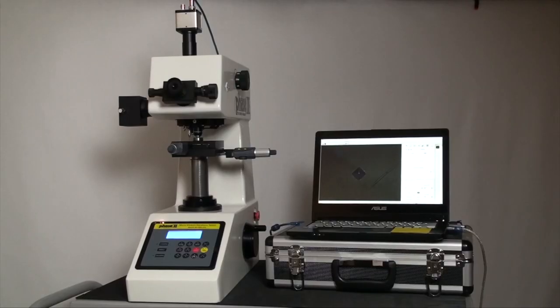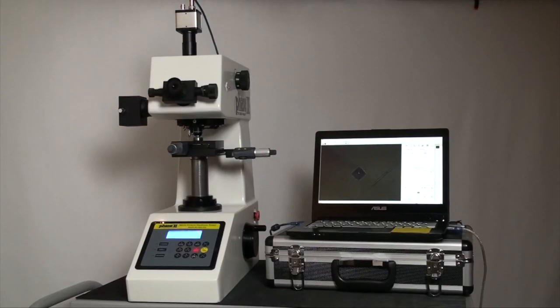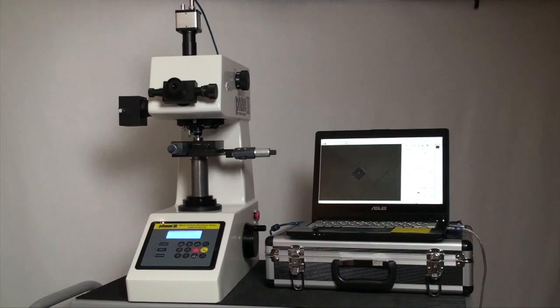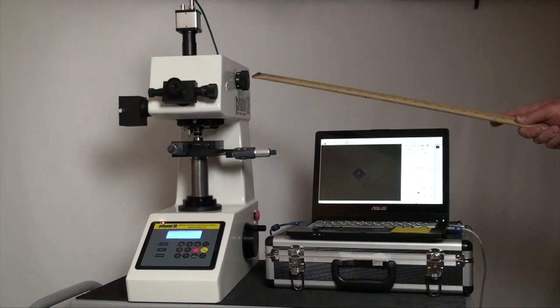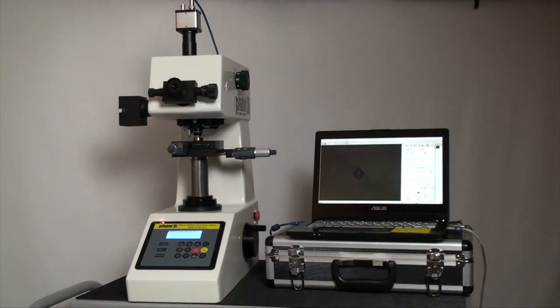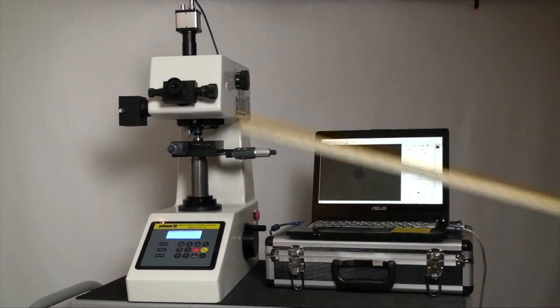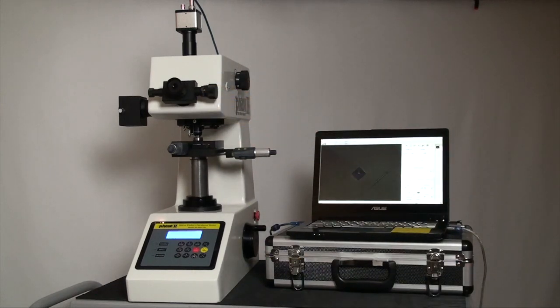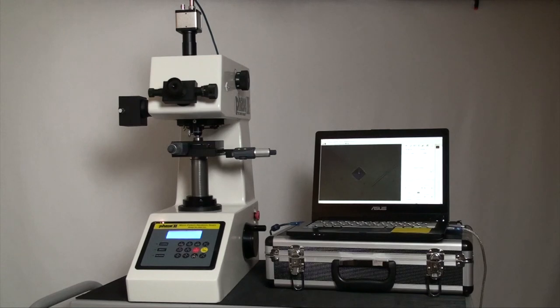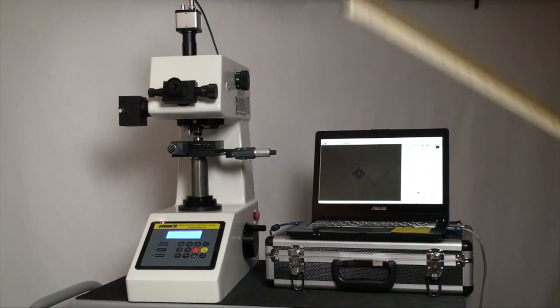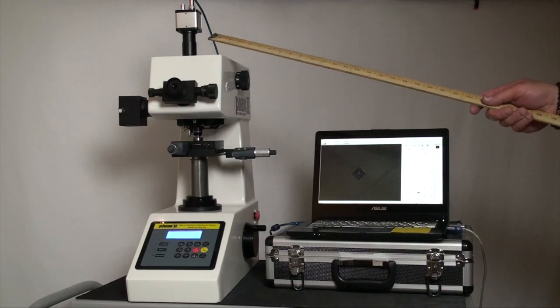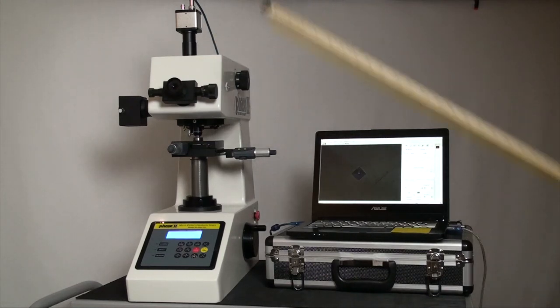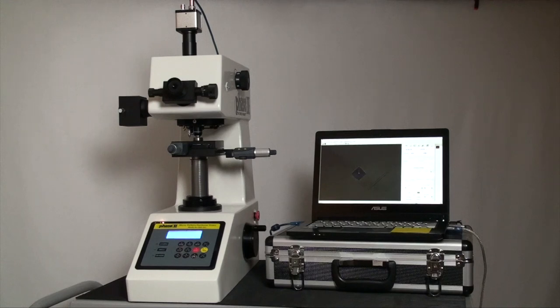Let's begin with the unique design of this series hardness tester. Here we have the weight load selector, the manual optic system with left and right measuring drum wheels. Though for today's demonstration video, we will use the digital optical system you see installed here on top and connected via USB cable to a laptop.